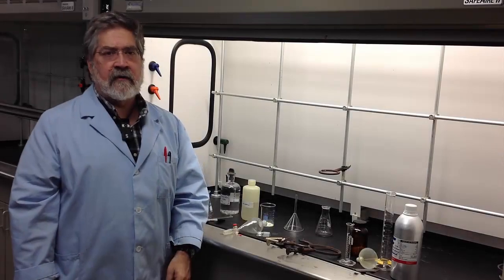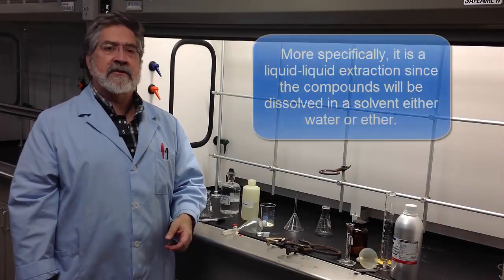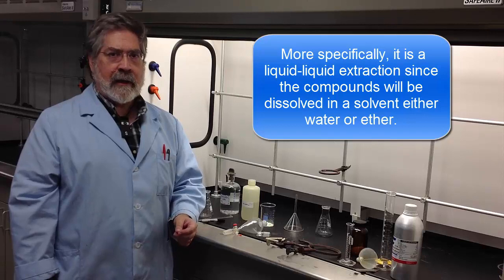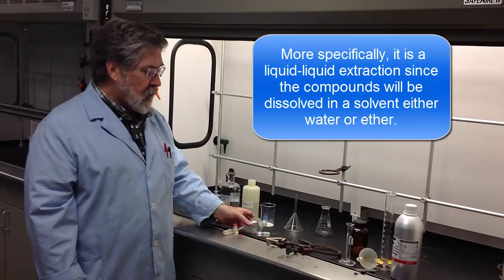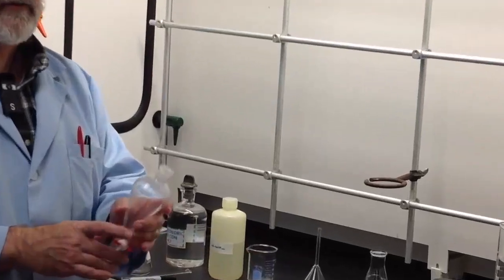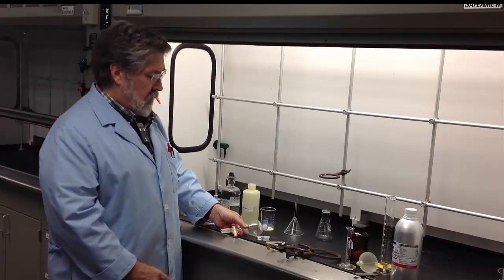This week's lab involves the separation of two organic compounds. One of them an organic acid, the other a neutral compound. To accomplish this, of course, you will need your separatory funnel, the matching stopper, and a ring clamp.